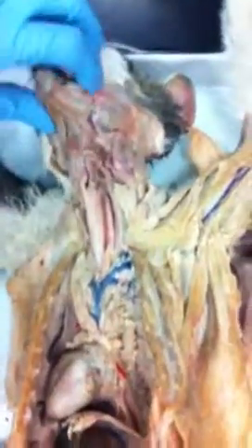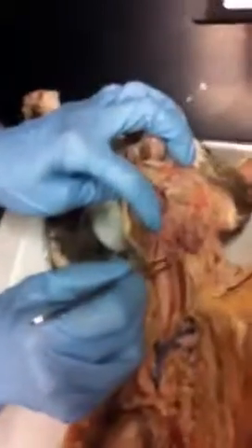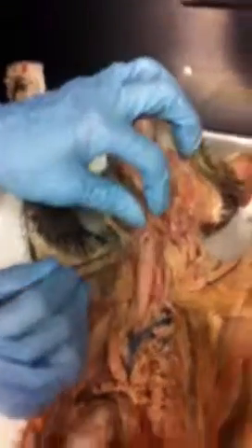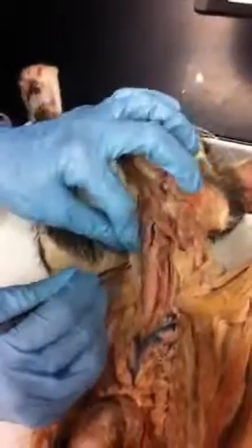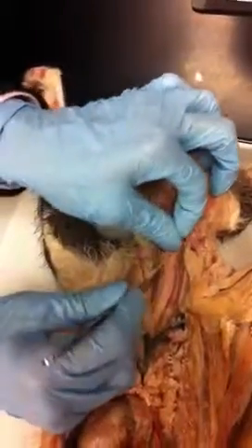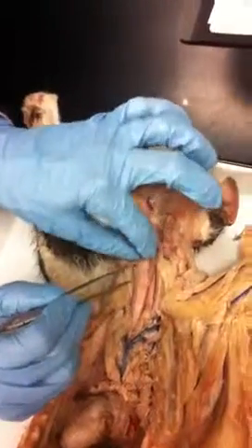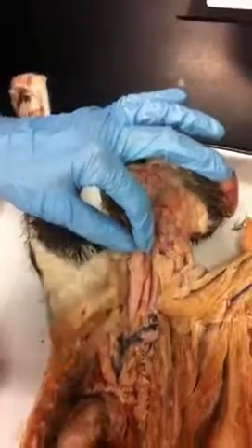Oh, I think we have a thyroid gland on the side. Yeah, you do right here. You have one. They're located just below that thyroid cartilage, and there's one on this side, and then a transverse piece that connects the two of them, like saddlebags sitting there.